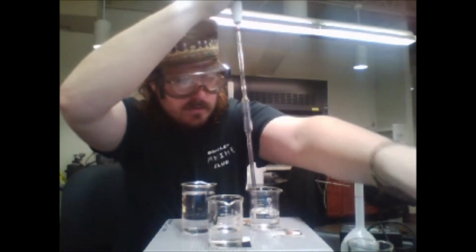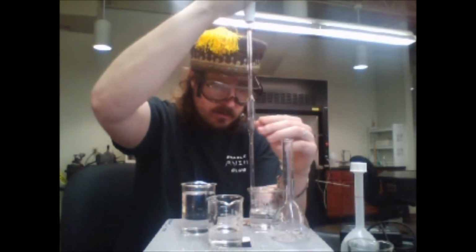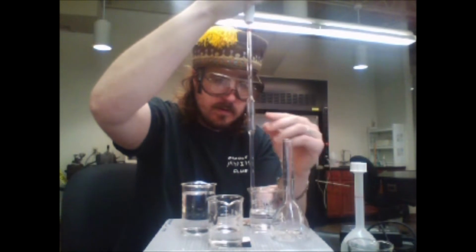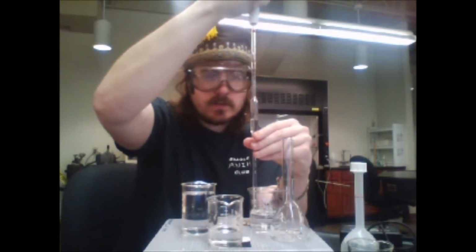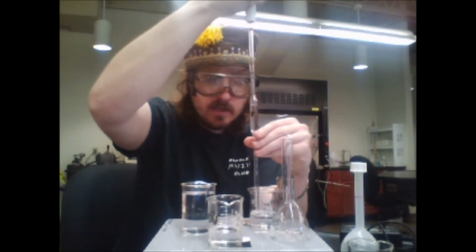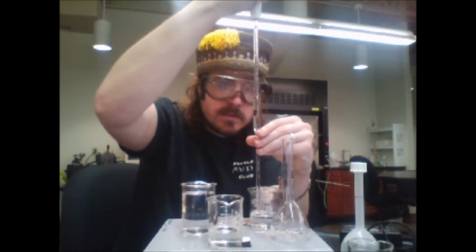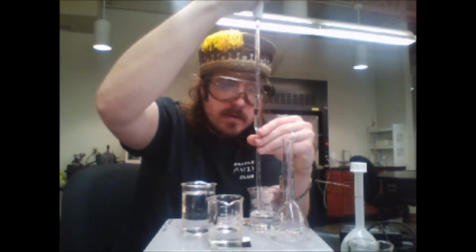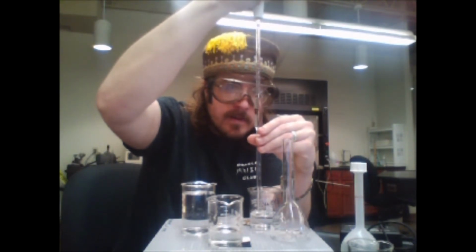Now I'm going to put in exactly 10 mils. I'm not going to zoom in on this. As long as I get this on the spot, we can feel confident that it's exactly 10 mils.